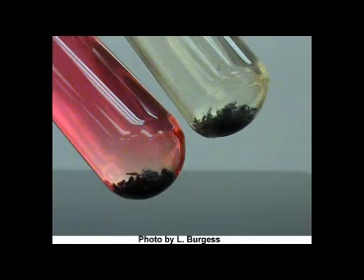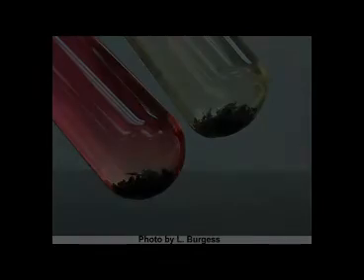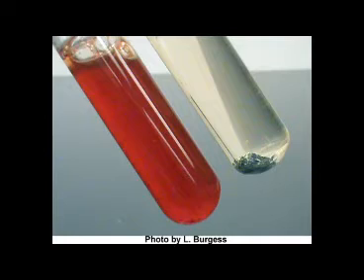A key way to tell the difference between a red positive and a red negative is by the presence of the zinc powder in the bottom of the tube. Now shown are the 2 possible positive reactions. The tube on the left is positive. It turned red after the addition of reagents A and B. If the tube turns red after the addition of reagents A and B, no second step is necessary.